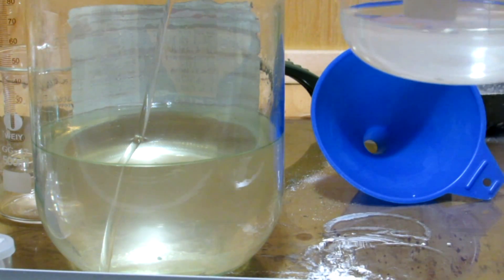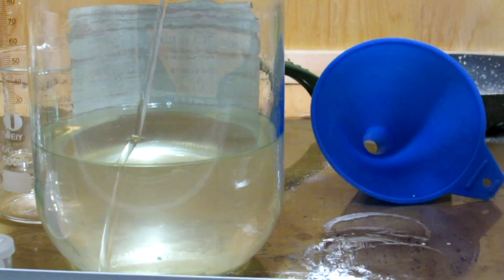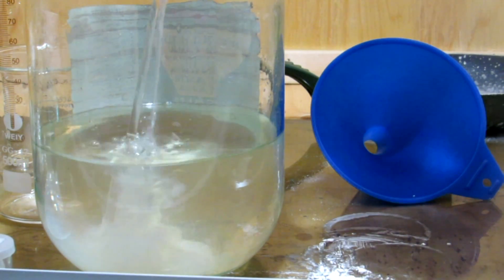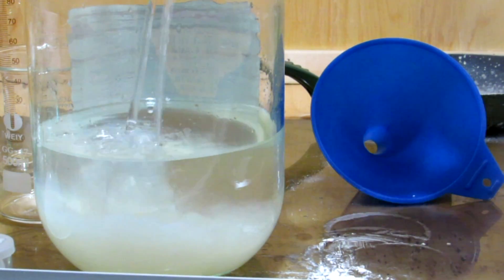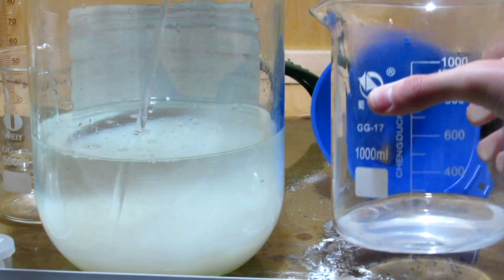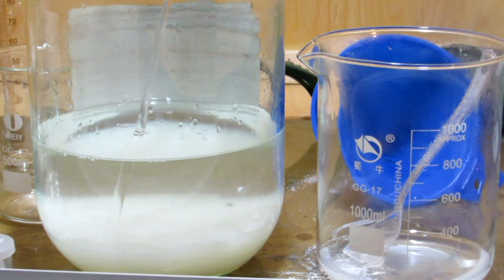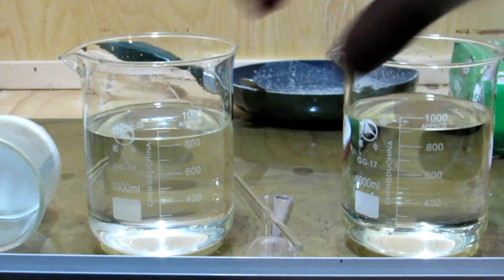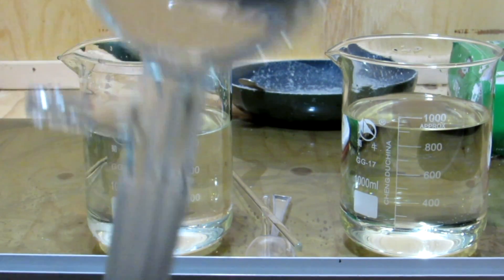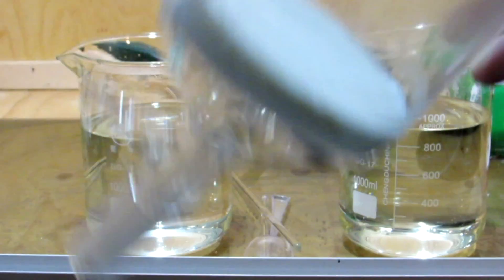Something else I noticed that's interesting is when these two solutions were added together, some calcium sulfate precipitated out. Turns out that calcium sulfate is slightly soluble in phosphoric acid solution, but when we neutralize the acid it caused it to decrease its solubility and precipitate out. Some calcium hydroxide may also be formed and precipitate out, and this might be what we're seeing. After filtering off this last bit of calcium sulfate or calcium hydroxide or whatever it was, we need to boil everything down.